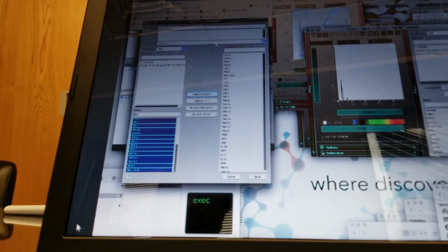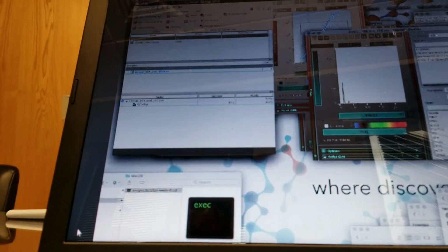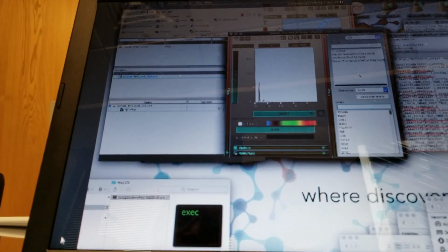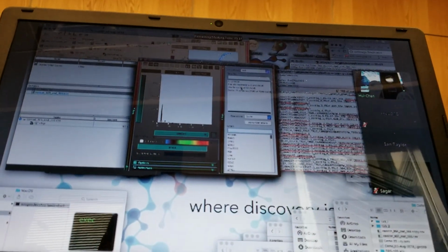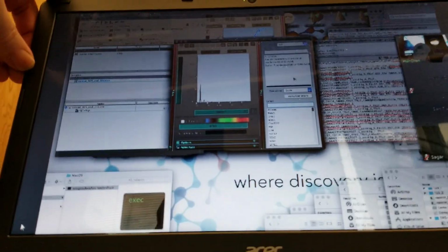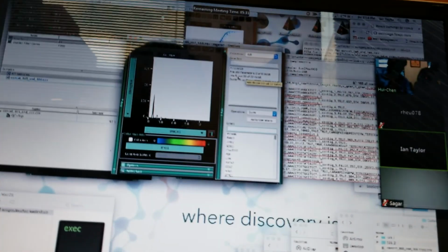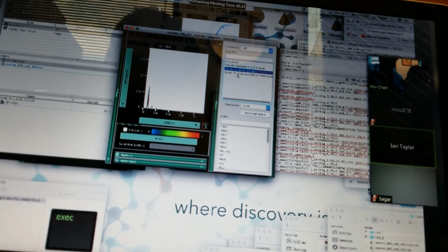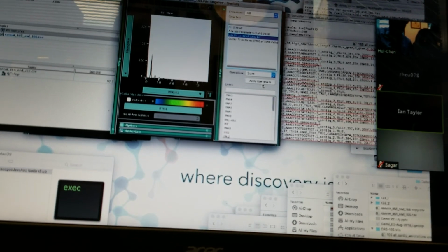What we really want, this would be great. And then identify those cells. This is what we want. Identify those. So now there's a couple of choices we would make, and I'll just try it out and show you what I'm thinking. You can look for cells that are expressing any of these genes by choosing this gene set and looking at the sum of expression for those 32 genes.